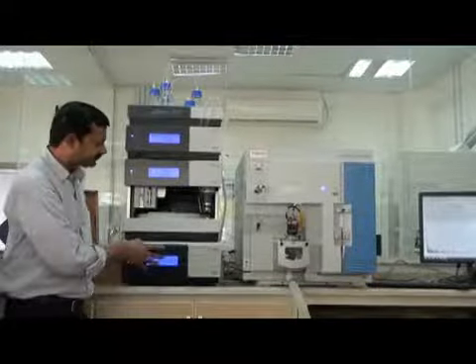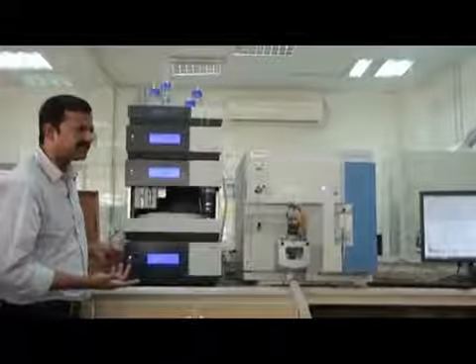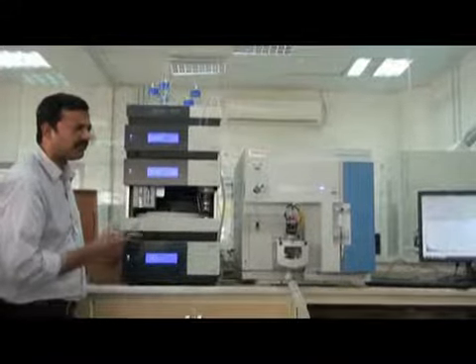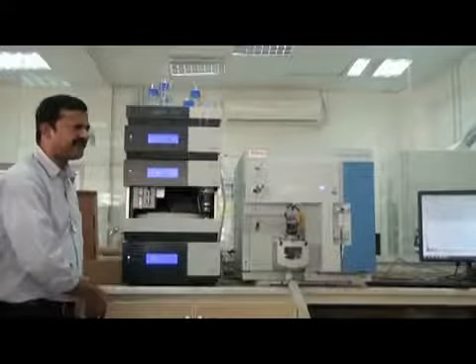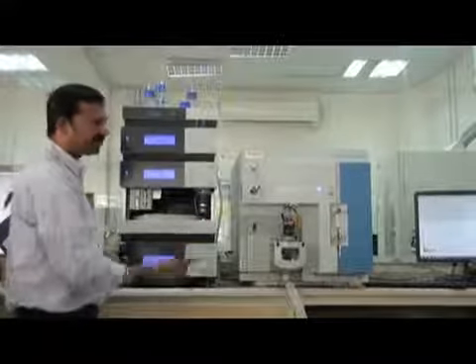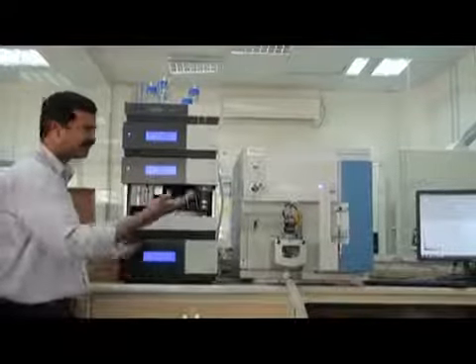Will the company supply you a new column or not? Yes, our company supplies columns. Will you give me another one? I don't know, I will write it down. I have already told Moyer also. I know you told them. Did he not reply to you? No, I did not reply. Yesterday I saw his message asking about things, so I told him that the column is not very good. It's a short column. In the application note, a long column is written. So I hope they will arrange it. But right now we have only this column, so we have to work with it. Later on you can change.